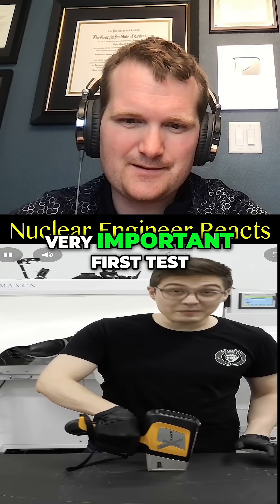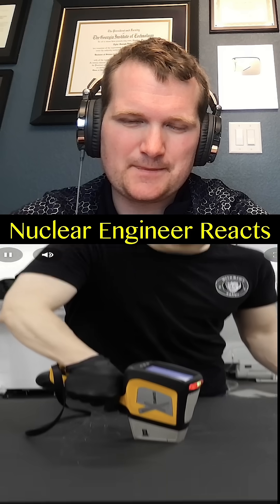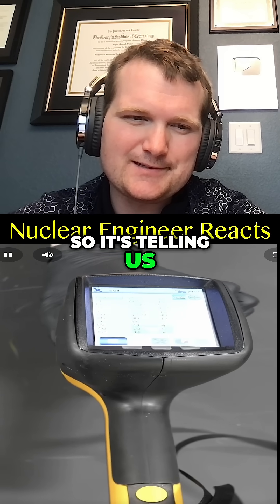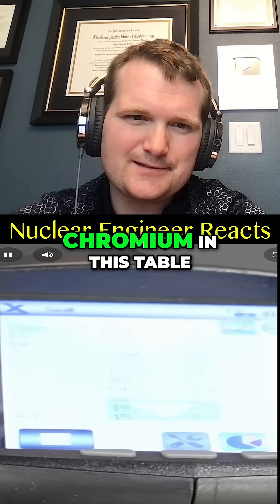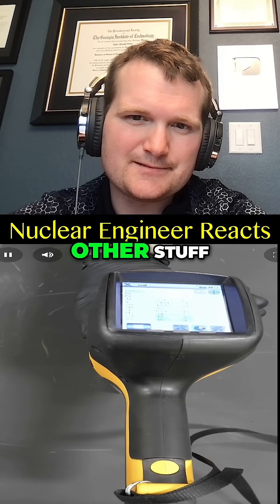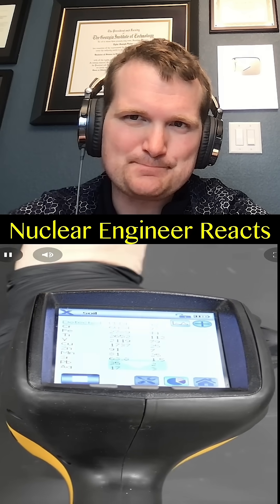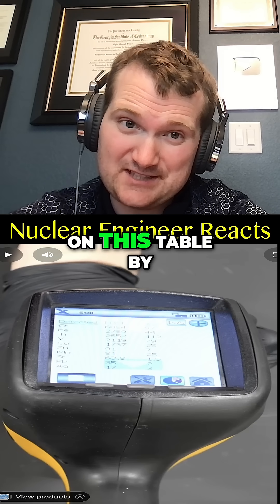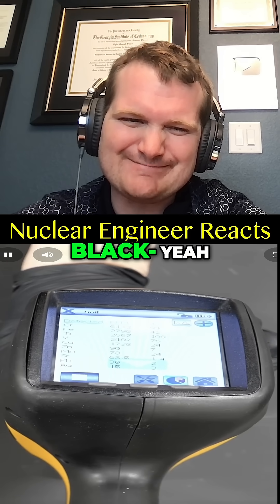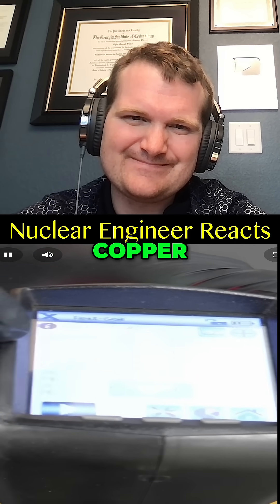The very first test — let's just shoot the table. We're blasting x-rays at the table. We mainly get the paint, so it's telling us there's actually a lot of chromium in this table. It's not going to detect carbon and other light elements, but metals — these are the elements in the wood apparently, and possibly all the stuff that got broken on this table from doing experiments. At least in the paint.